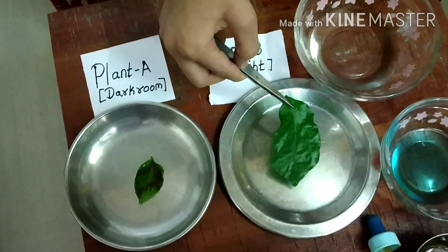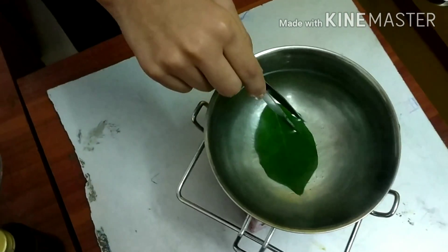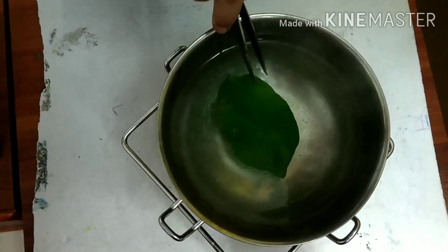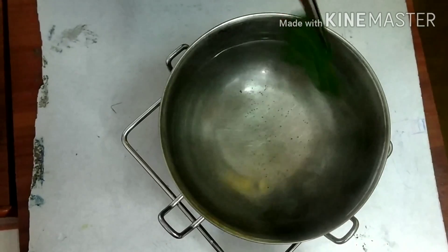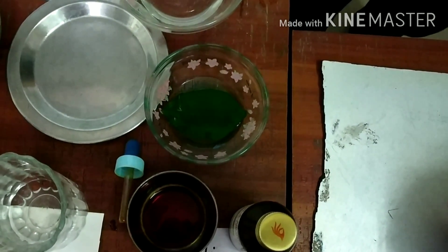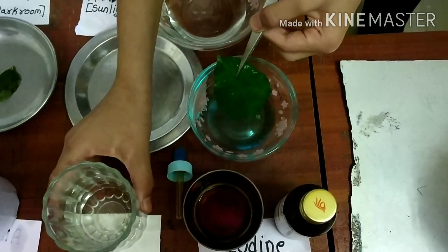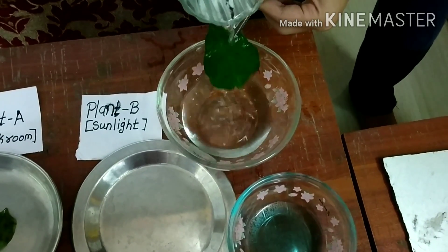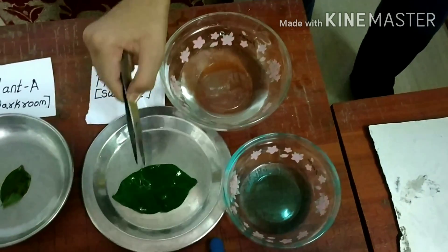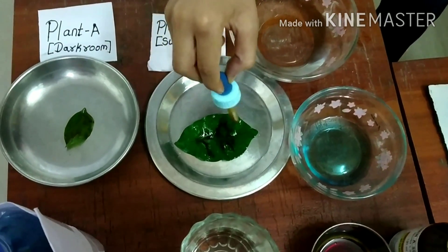Meanwhile, we will take Plant B which is in the sunlight, boil it, and let it sit for some time. Now this leaf has boiled nicely, so we will take it out and dip it into the alcohol. Then we will take it out and wash it with normal cold water and let it sit for some time.